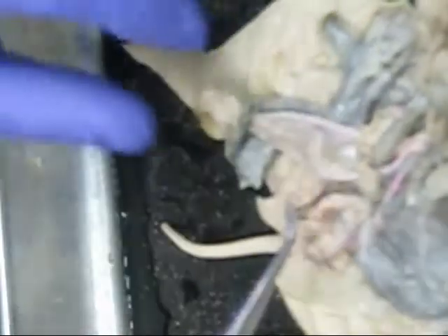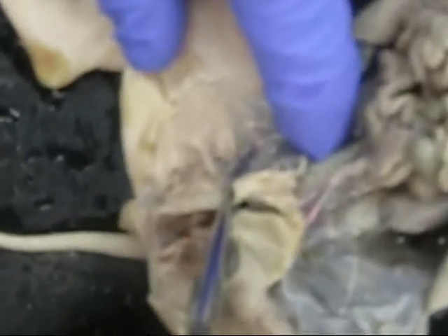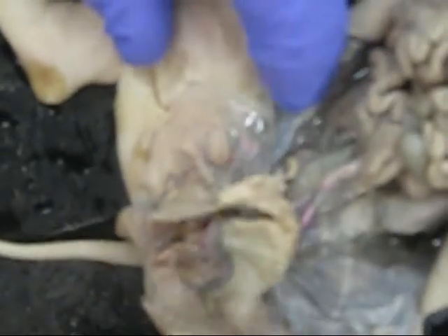But Dr. Lee said they were so small they probably wouldn't test on it unless it was really, really visible. And I don't see the corresponding structures on the other side. They're underneath the slab of tissue. This one is the right iliolumbar artery, and then this one's the one that's not named. That's not going to be tested on. All right, can you flip the page?